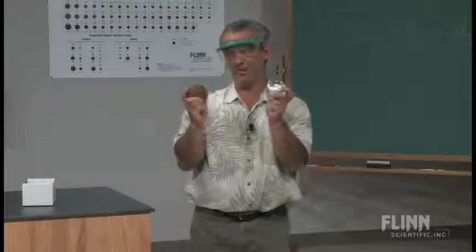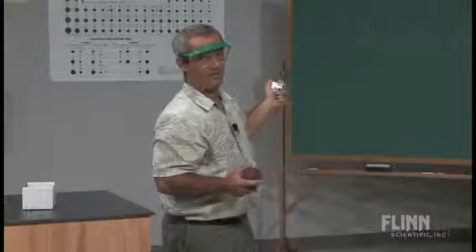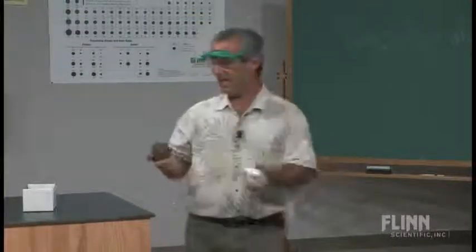Nice, easy to set up, little demonstration. It's got a lot of neat thermochemistry involved in it, the thermite reaction, and one that's so easy to do. Thank you.